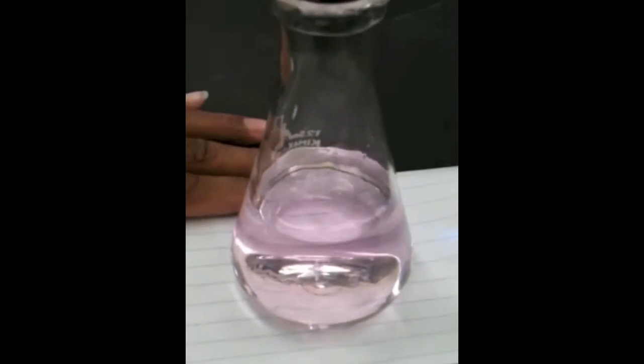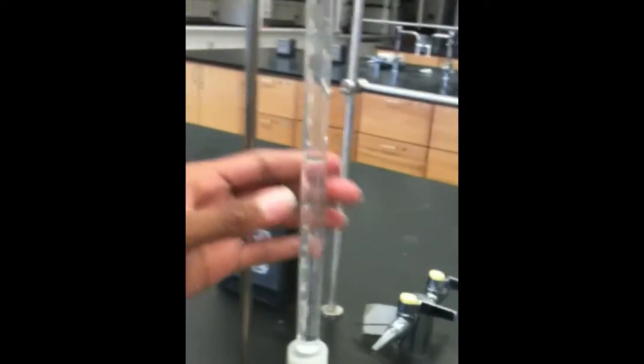And we've reached our equivalence point. So when you reach your equivalence point, it's going to be a really faint pink, and you can see it more closely on the paper. So we have the amount of sodium hydroxide that we started with, and our final is going to be 40.6 milliliters. So in order to determine the actual amount of sodium hydroxide that we added to the acid, you're going to take the final and subtract the initial: 0.0406 liters.